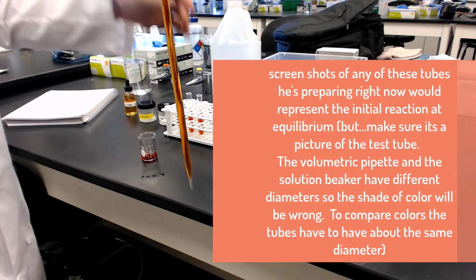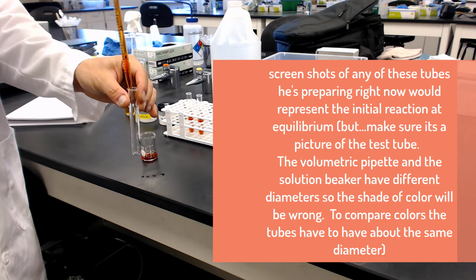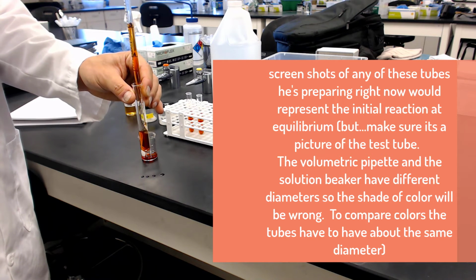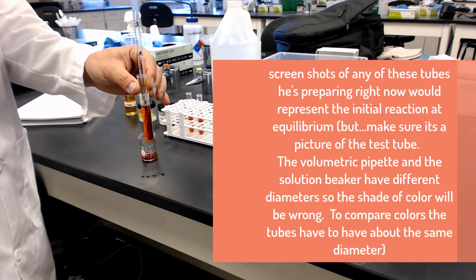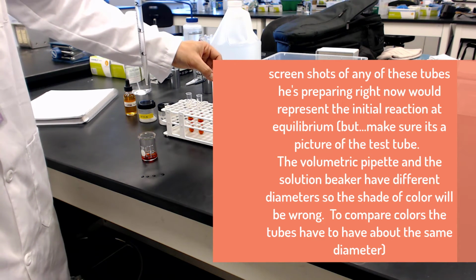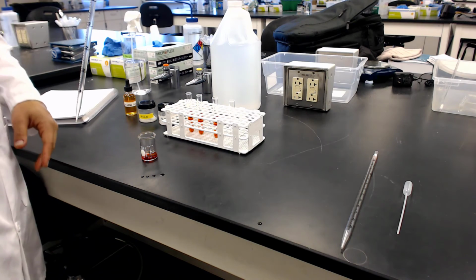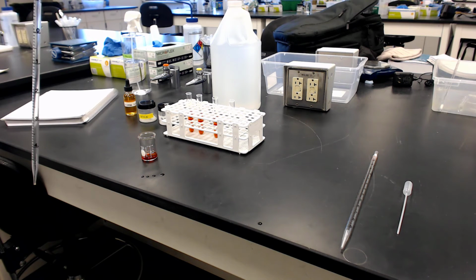He's trying to show you he's getting it to the mark at 5 and then dispensing all the way out. Again, not proper technique if you're setting up a calibration curve or something where the volume is critically important. These are kind of qualitative labs where we're just able to shift equilibrium with gross approximations.